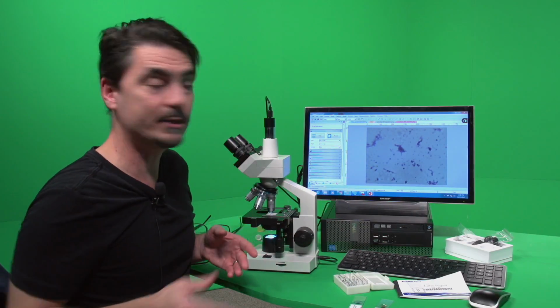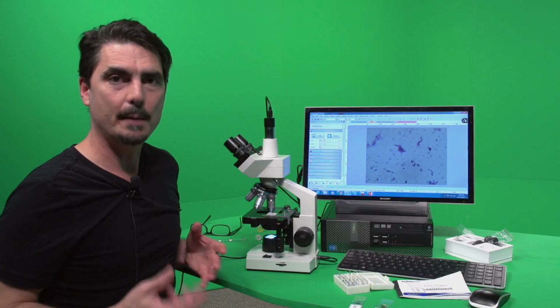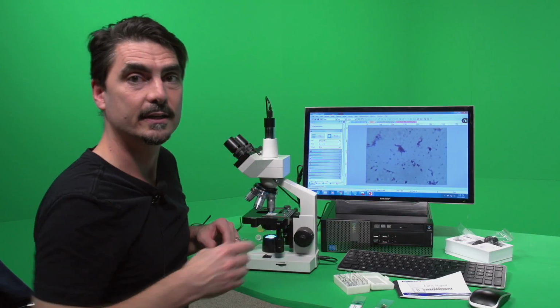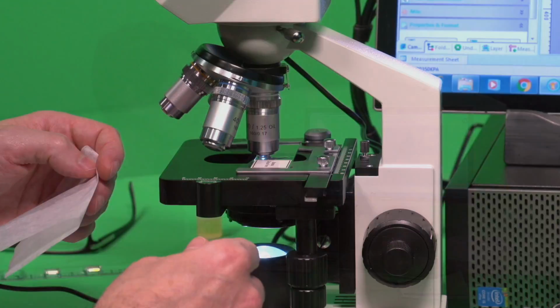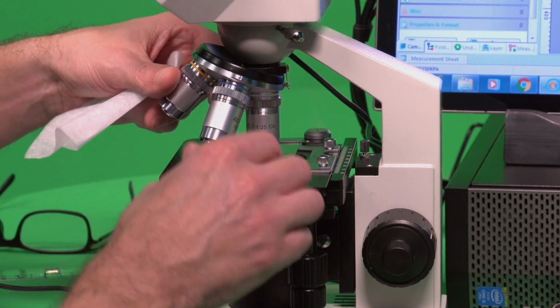So what we do is we snap an image of it, right? Using Snap, then we save it as a PNG. We upload it and we go with it, right? We don't get too worked over. If we have a nice, clean image, the best that we could get, that's what we do, and then we move on. So then the next thing to do, when you're done with your microscope, is to clean it off.